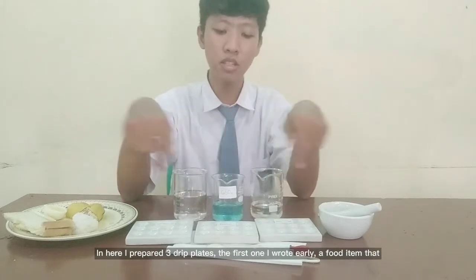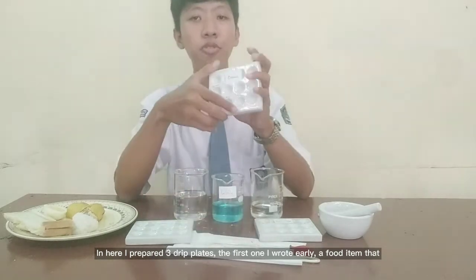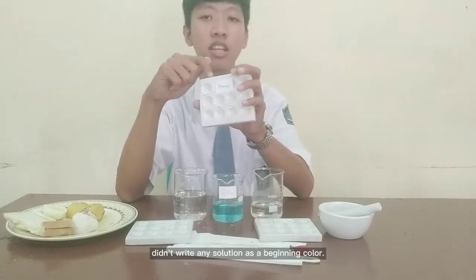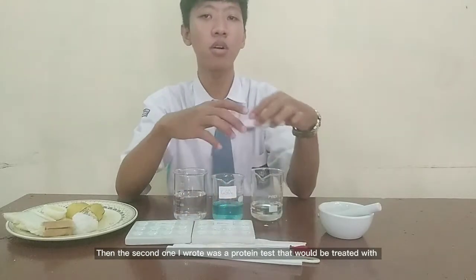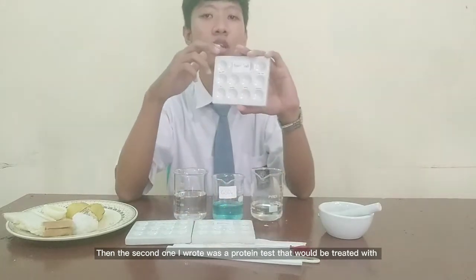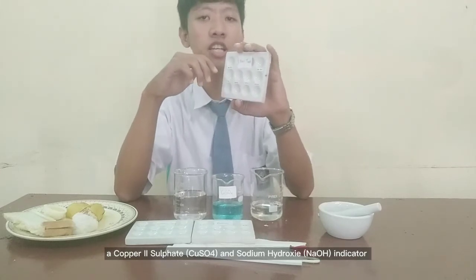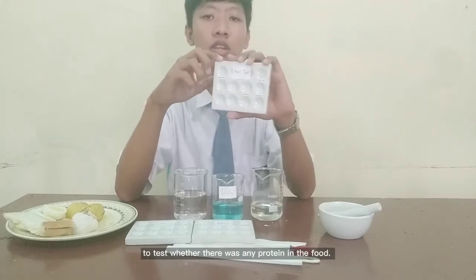Here I prepared 3 drip plates. The first one I wrote early, a food item that didn't receive any solution as beginning color. Then the second one I wrote was a protein test that would be treated with copper sulfate and sodium hydroxide indicator to test whether there was any protein in the food.